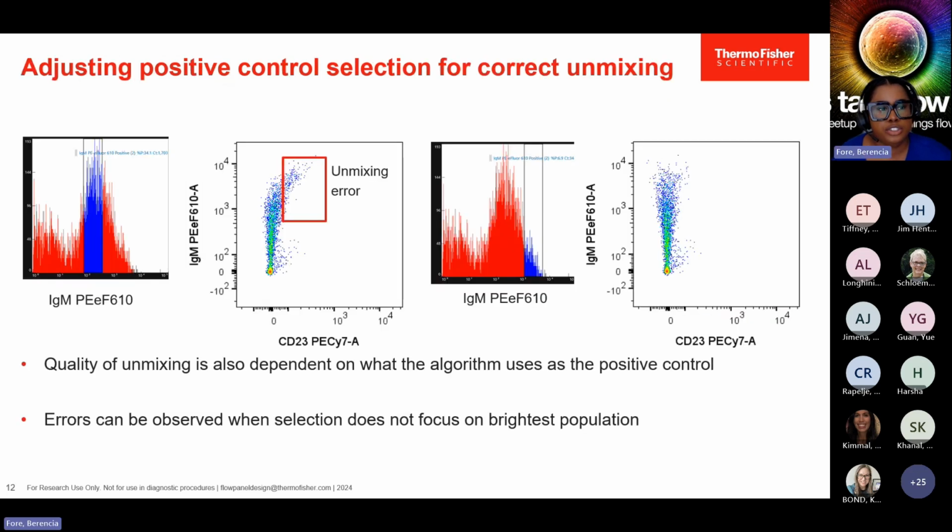So along with your controls, you want to adjust the selection of the positive in your positive peak. You want to adjust that for correct unmixing. Quality unmixing is also dependent on what the algorithm is using as the positive. You can see here that by grabbing the middle of the peak, we are looking at an unmixing error that has been translated into the actual data, because grabbing this area of the peak is not capable of accounting for the brightness of these events here, which is why we see this curve here.